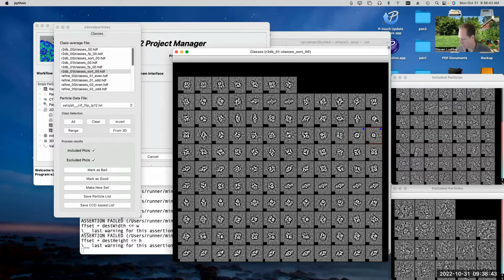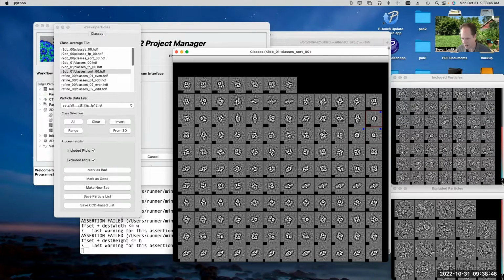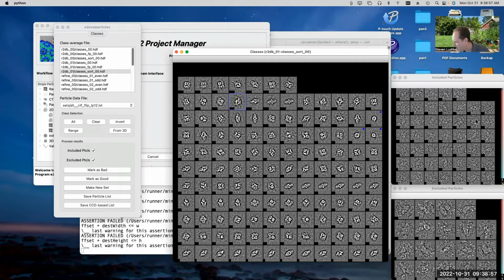And then I can mark all of the data sets, all of the class averages that I think are bad. Maybe I don't like this one, obviously. These particles were automatically excluded, so it's kind of okay that they're there. And these particles look like they may be kind of okay, but it's a little bit of a low contrast mess. So maybe I'd want to get rid of that one too. Most of the rest of these are actually pretty nice looking. So once I've marked them, then I can say mark as bad. And then if I build new sets in the future and I tell it to exclude bad particles, then it'll make new sets which don't include any of the particles that I've marked in blue.